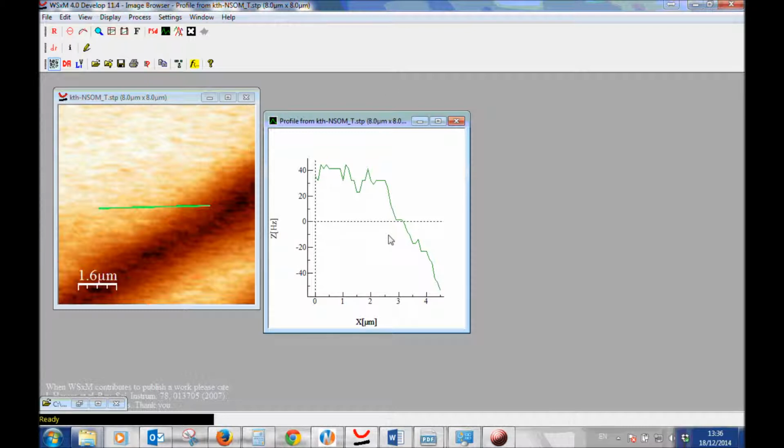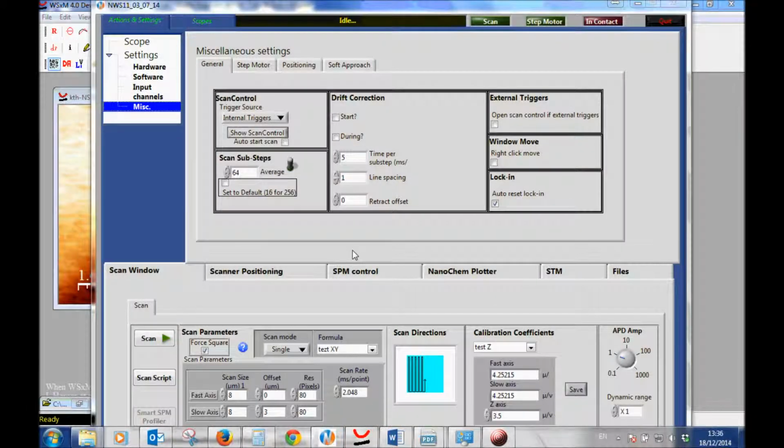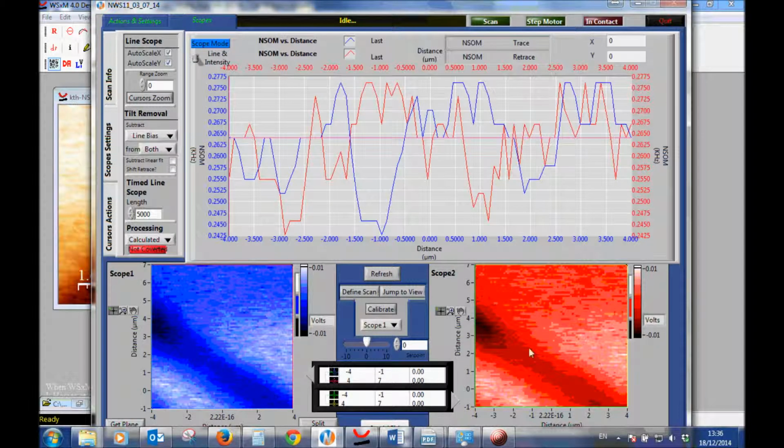Just to show that this is the issue with this software, let's look at the NWS program. So here's our image, and now we can also save it not as a STP file but as an ASCII file which we can open in an Excel sheet. So first we want to make sure that we measure the calculated values, not the raw data.